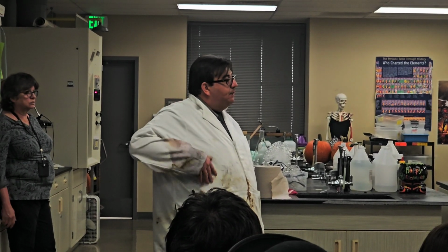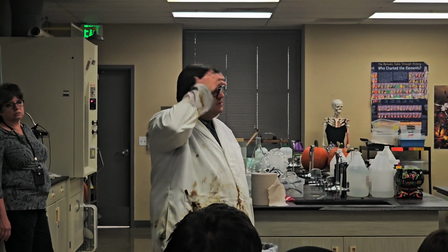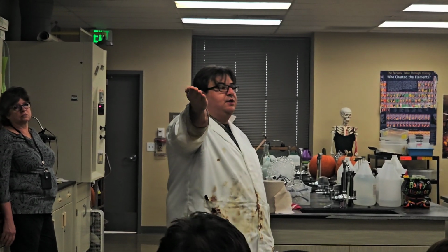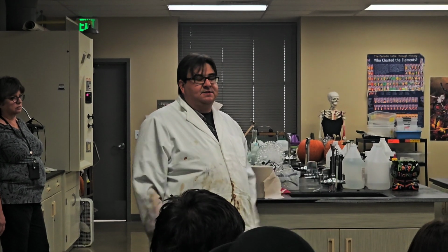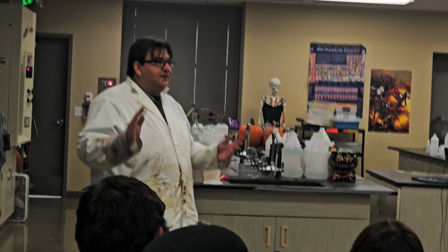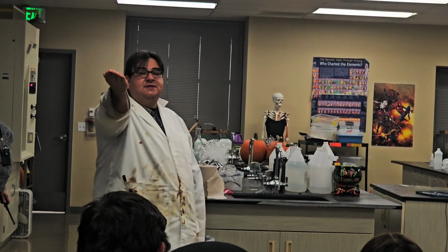Again, what direction does fire go? Up. That means if you pull your arm down, fire goes up your body. Goodbye eyebrows, goodbye hair. Okay? We don't want that to happen. You want to make sure that you are holding and standing still. It lasts at most 2 seconds. You will survive. You will not get burned severely. And you'll be okay. All right? So you just stand there.